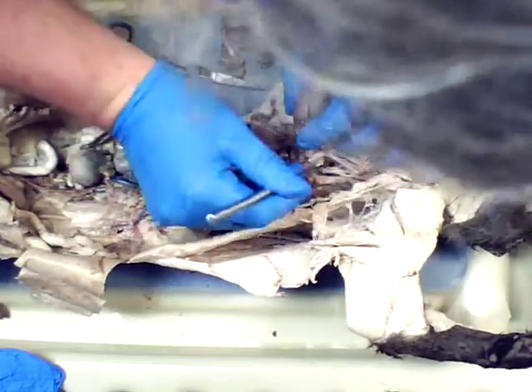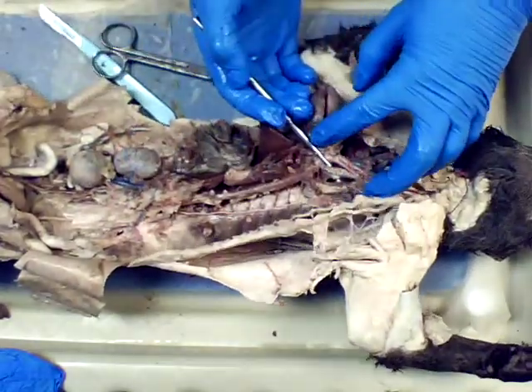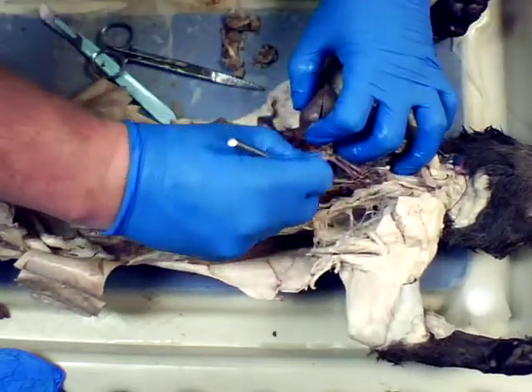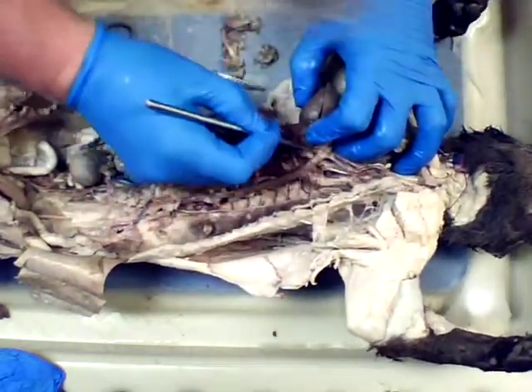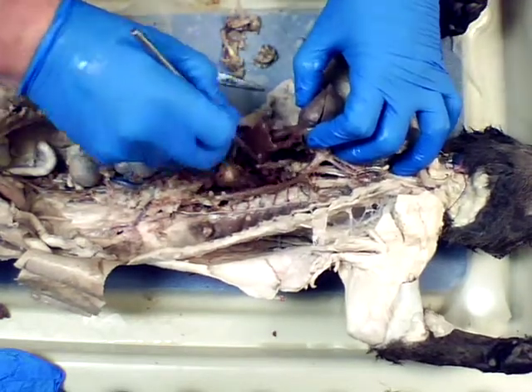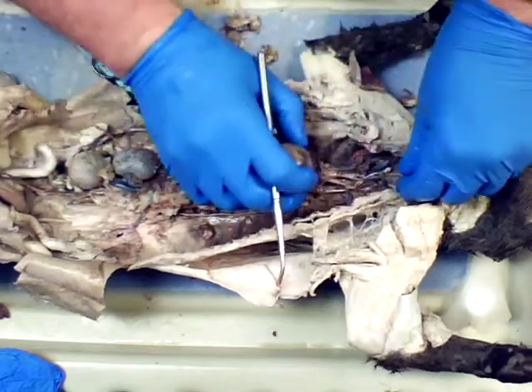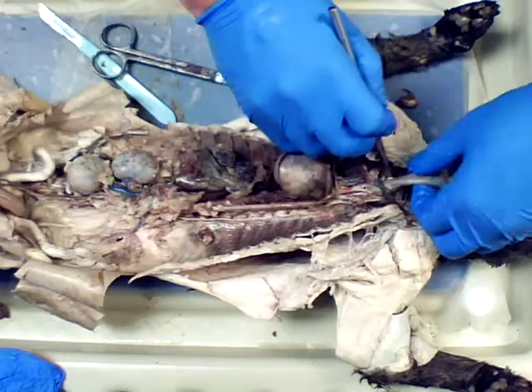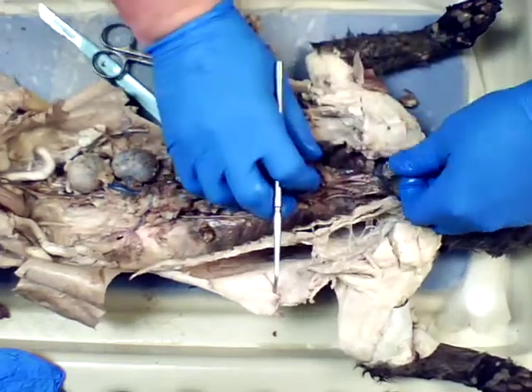There's my trachea right there under my thing. There's the trachea coming down into the lungs. So since there are no lungs, we can trace that over to here, which is where the bronchus would be, and there we go. Okay, we'll get the bronchioles exposed. Pull that out. So we're going to pull the trachea out. Pull it back up through here. Maybe.